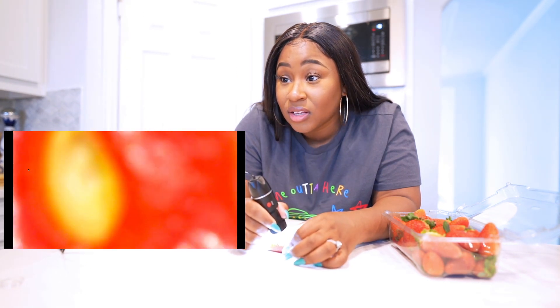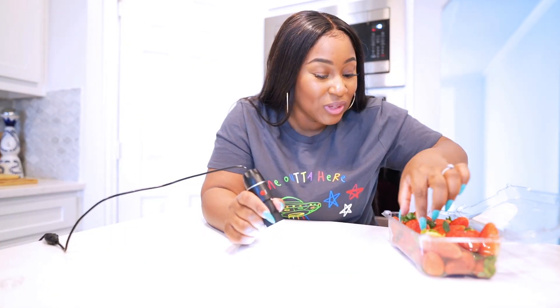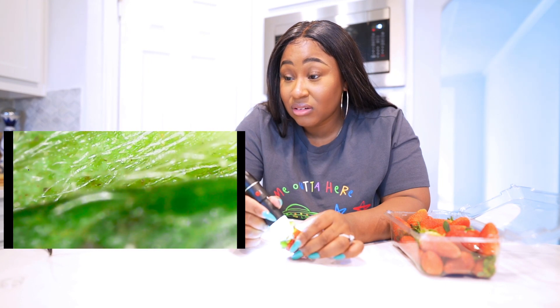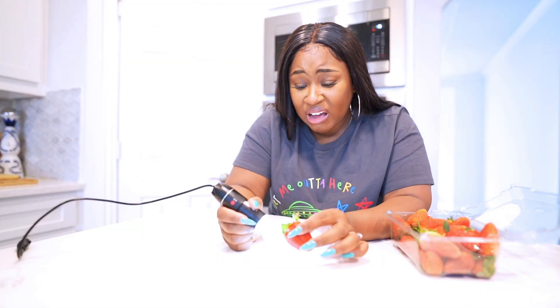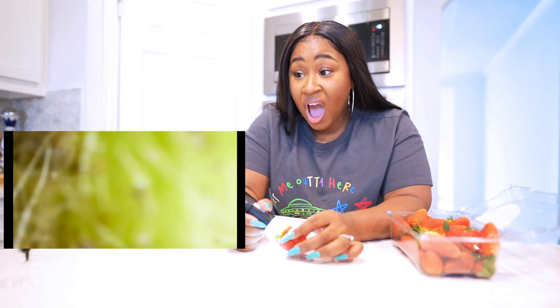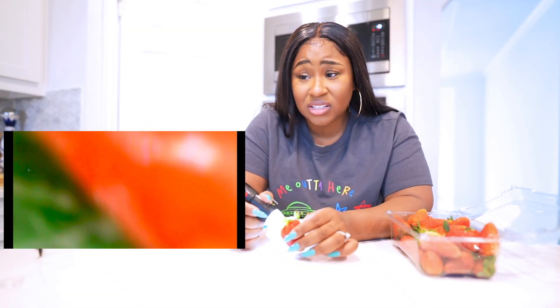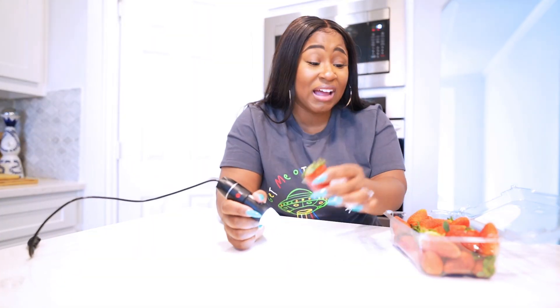This is not it. If I see something crawling, y'all, I'm literally gonna run out this house. That's the seed right there — look at that. Let's look at the top, the green part. Oh, I mean it's a nice little color on there. Oh gosh — y'all, I get really freaked out. This is on the leaf part right here. My face is about to be jacked up this whole entire video.